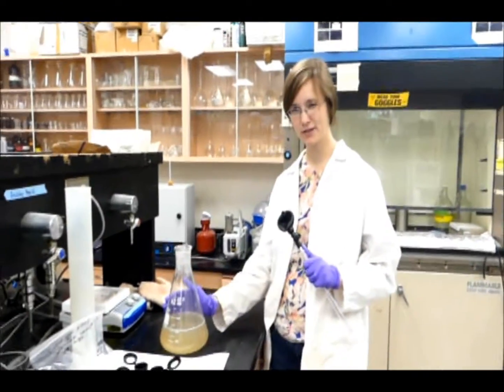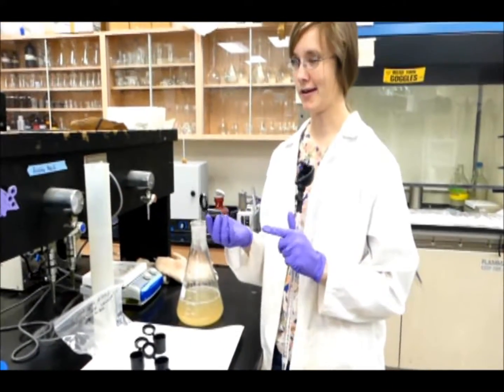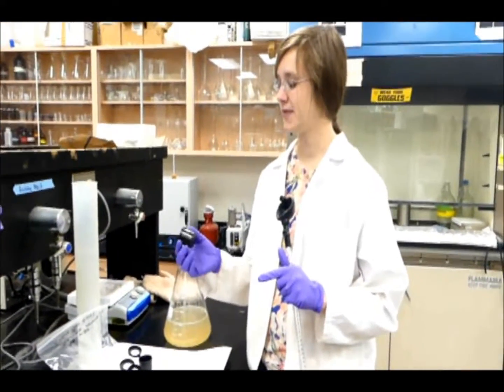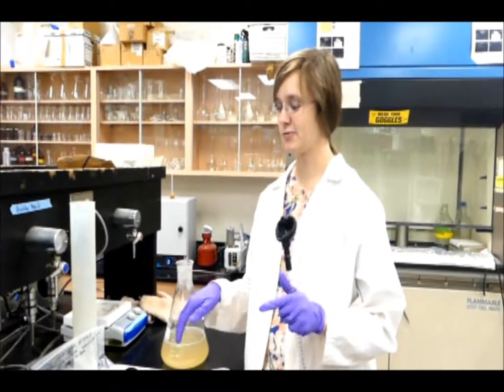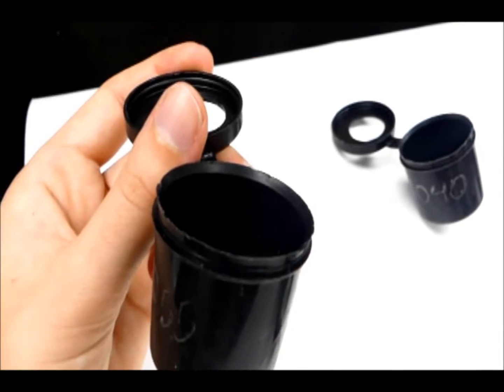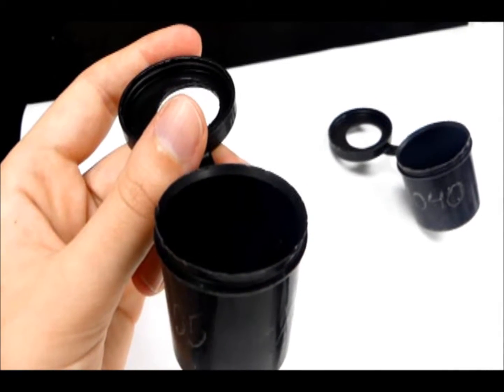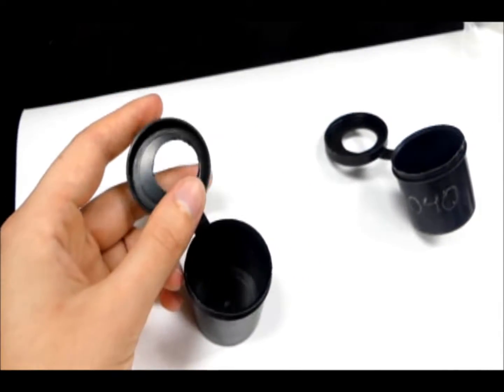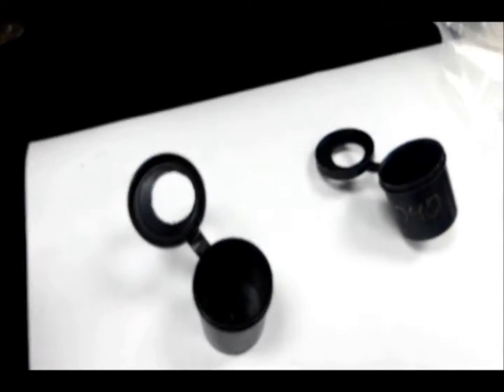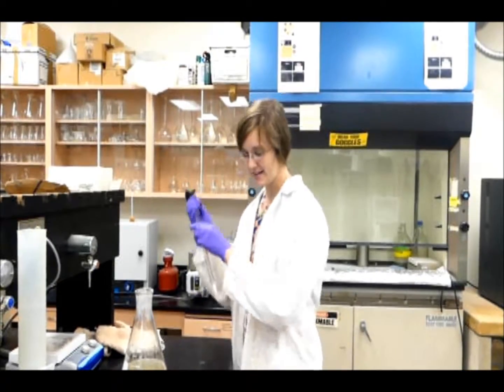We've let it cool down a little bit. We've labeled all of our cups because we want to know what nutrient we put in all of them, and that way we can figure it out after they've been in the river a while. So we want to fill these cups in between the 2 ridges because we want there to be enough room for the disc to still fit on the top, but not too much room that the discs will move around on top of the agar. So I'll start by pipetting now.